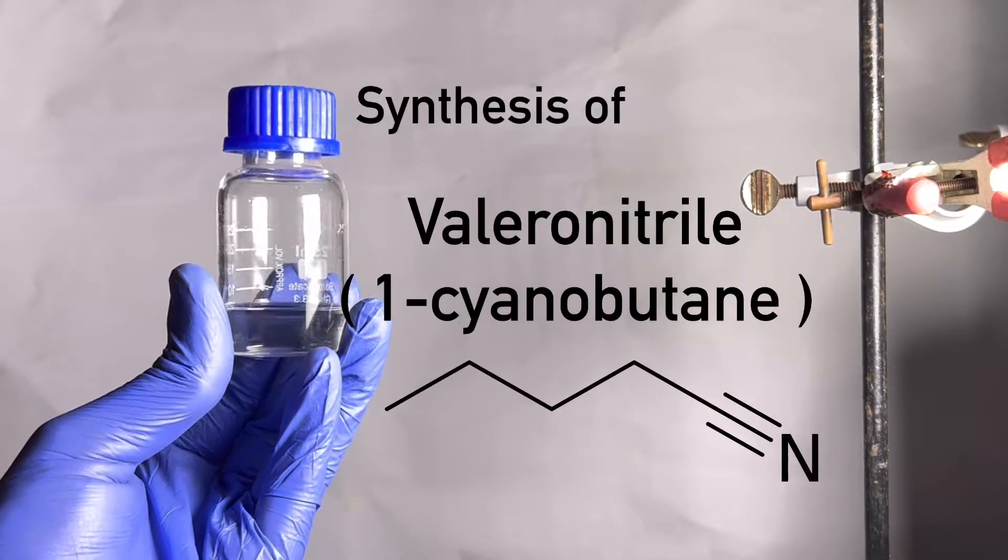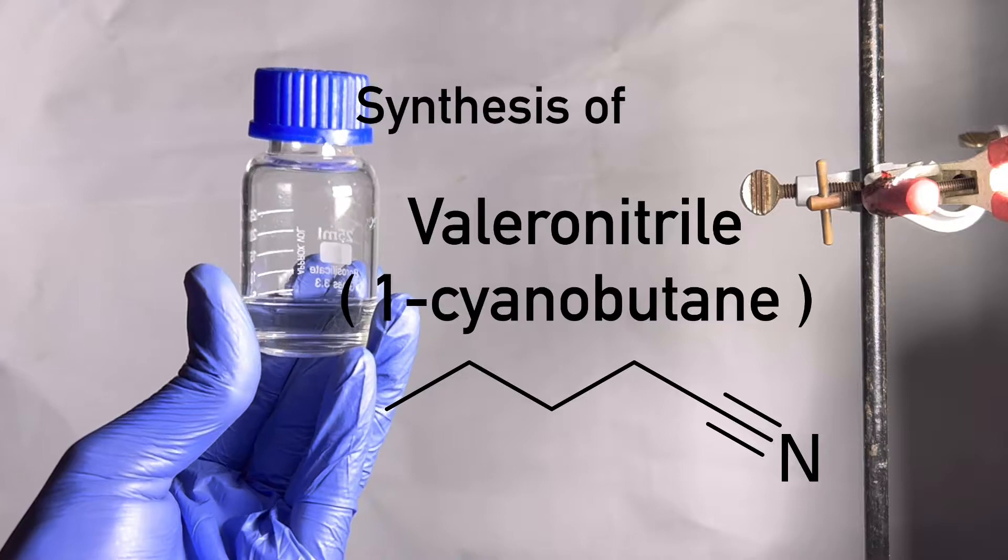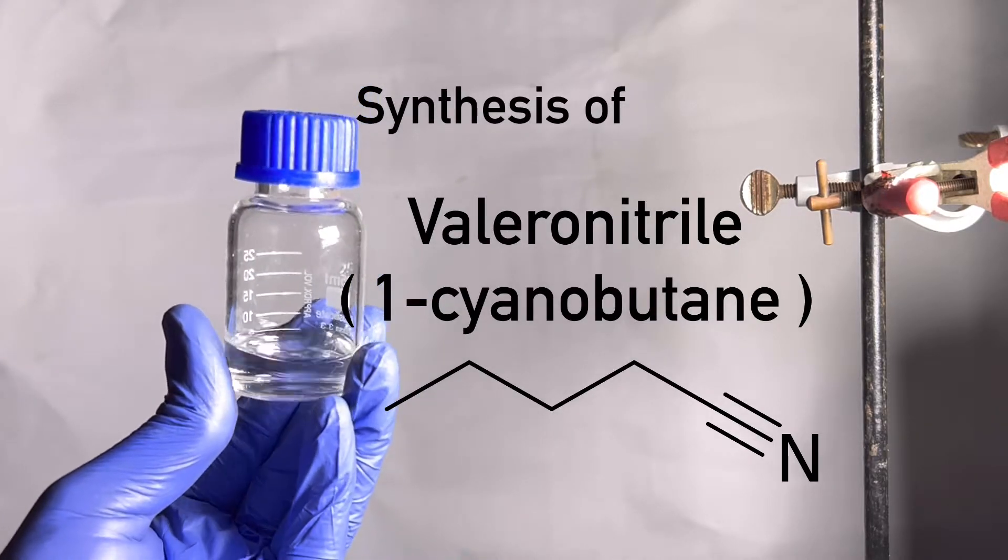Hello friends, in this video we will synthesize valeronitrile or cyanobutane.